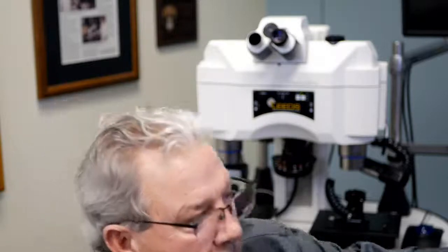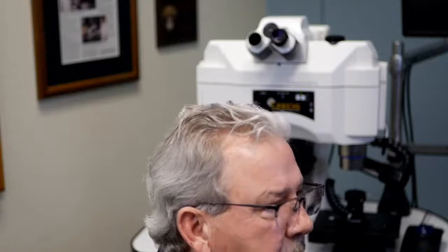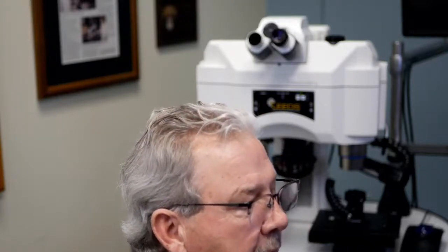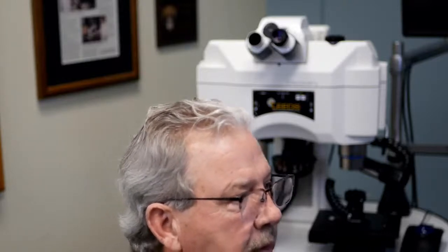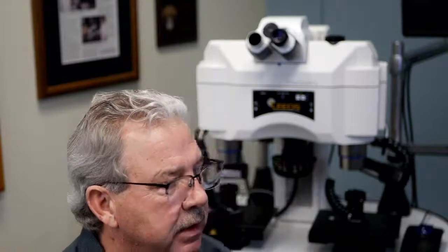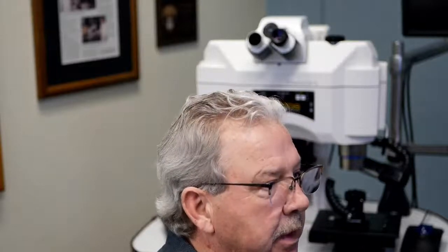Okay? This is from the 22mm field of view eyepiece I just showed you. What you can see is I'm actually measuring the diameter of that ring. This is a little plastic sleeve that threads up into the microscope, and it's got a shelf on it for my reticle to sit in. So that's what I was trying to show you in that picture there.